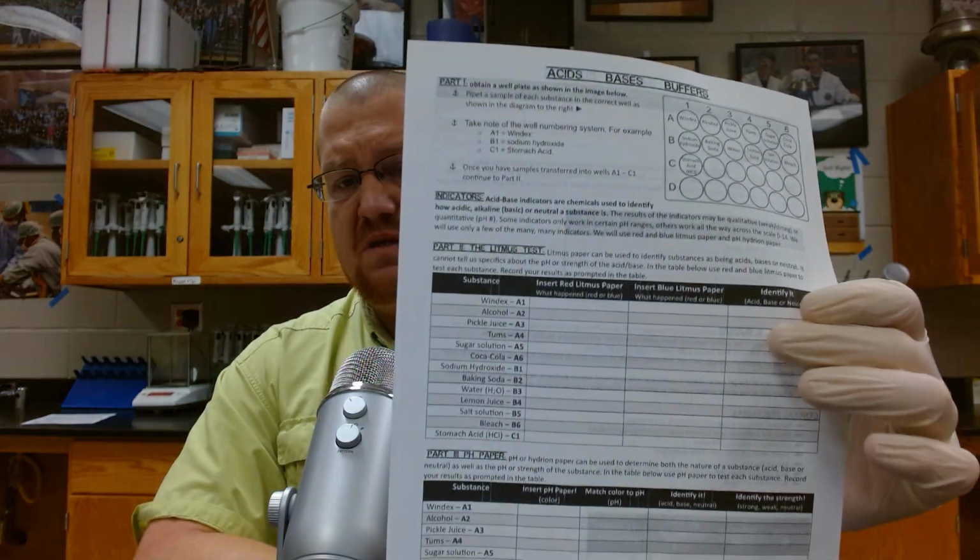This is what our sheet looks like today. We have several data tables to fill out. This video will not dive into the last two sections of this. There are some blog posts that I have put up in the past that dive into detail about those, the part on the buffers, if you want to check those out. So let's get started.